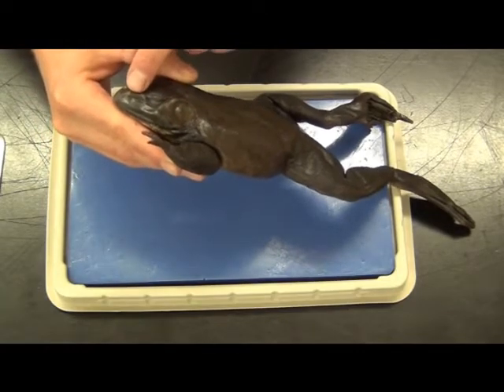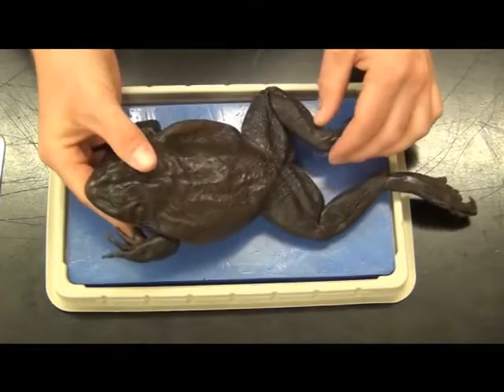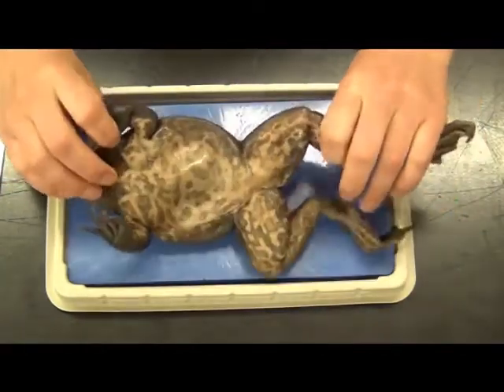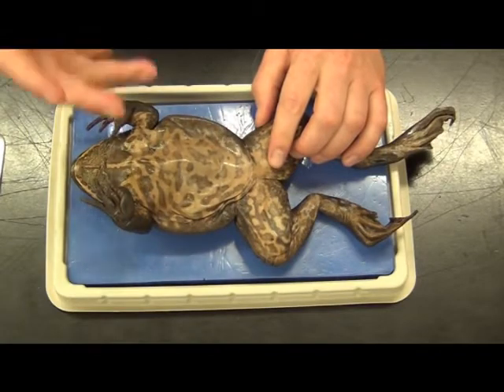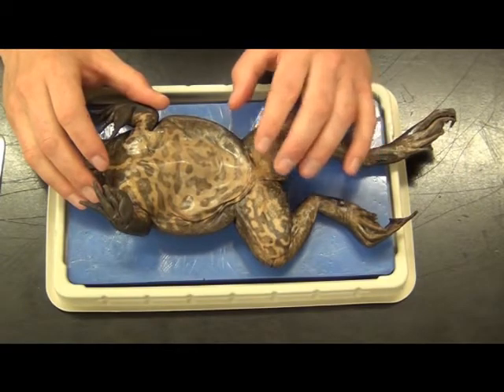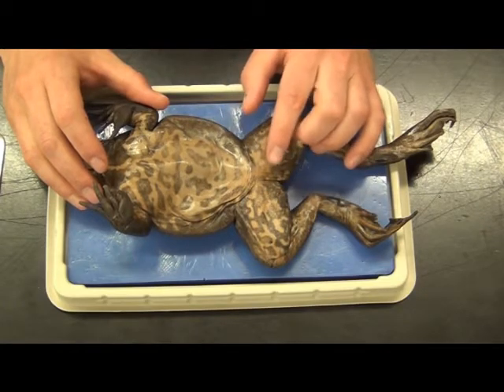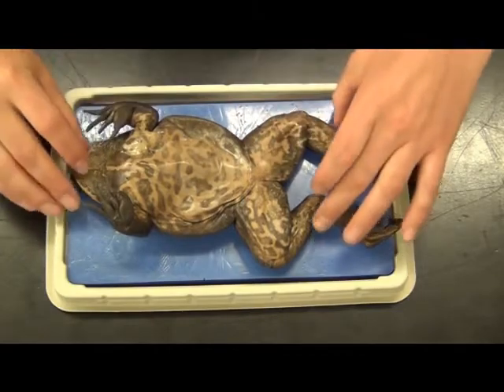You have external nares, which we usually call nostrils, and the mouth. The only other difference we're really going to find from our mammals externally is back here — this is called the cloaca. For amphibians, they have a single hole that does it all: excreting waste, urine, solid waste, as well as sexual reproduction. It all occurs in the same area, in the same hole.